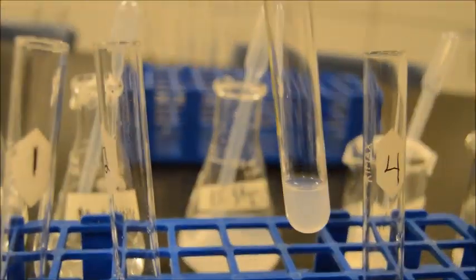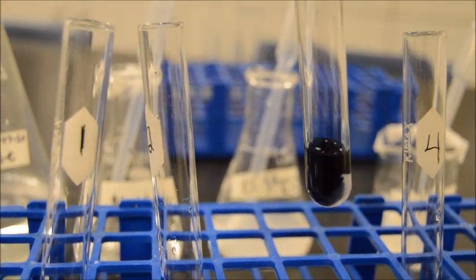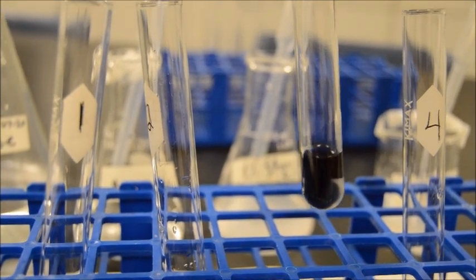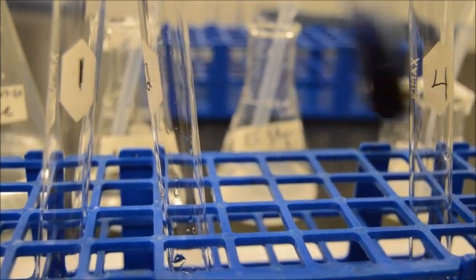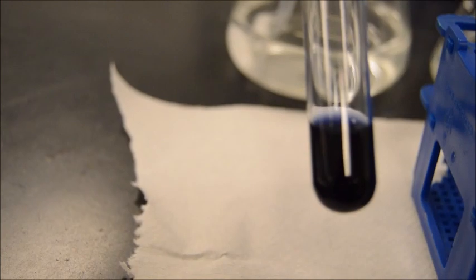Right, and here we have starch. Now let's observe the process. Whoa, look at the change! Very, very different. Remember, this is a test for polysaccharides. What we're looking for is a big starch molecule, and this is literally straight up starch. See against the white paper how dark that is? And you can see a blue on the side there. This is a nice blue-black, a very nice starch reaction.